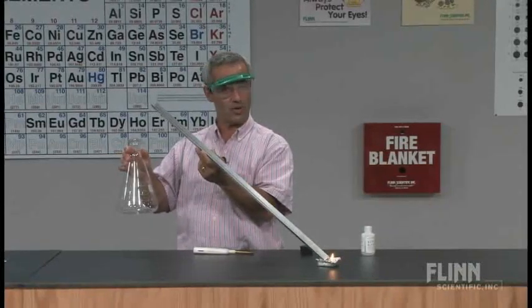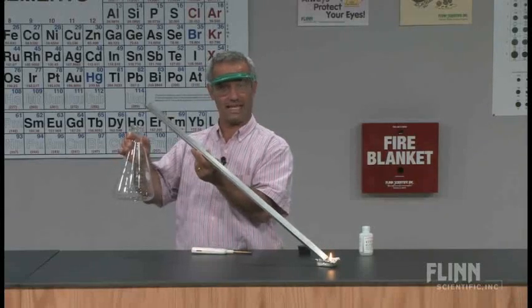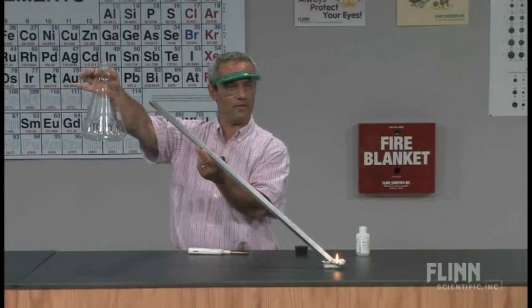So we're going to do the same demonstration, but this one is a little bit more presentable in the dark. So let's have the lights out right now. I'm pouring it right now. And you can see the flame kind of dancing in the bottle. Okay, now lights back on. So it persisted in there for a while.